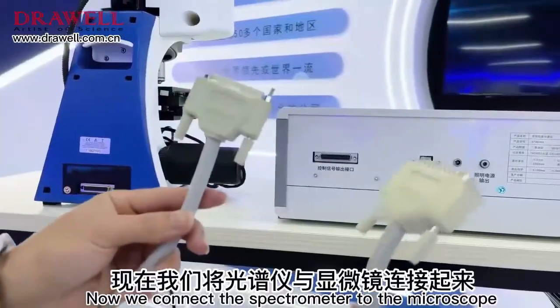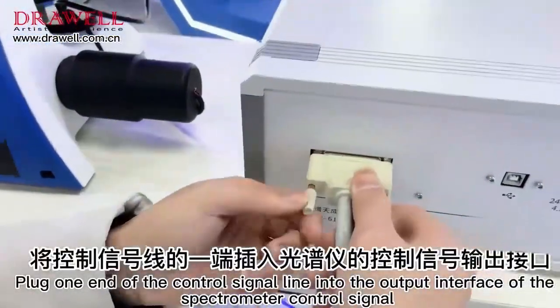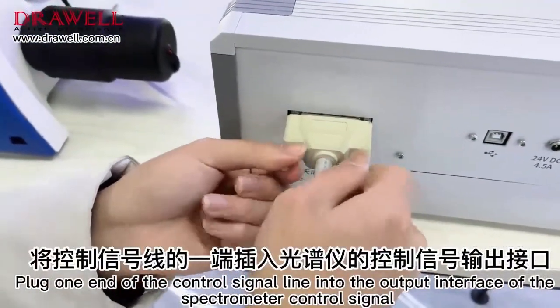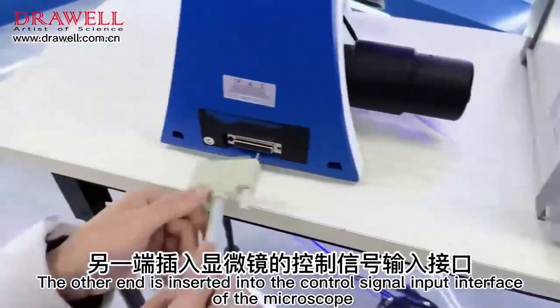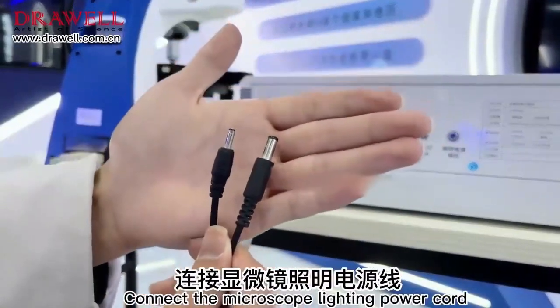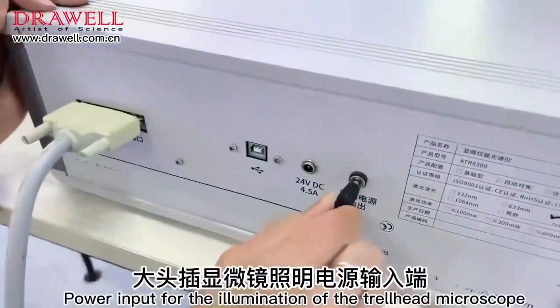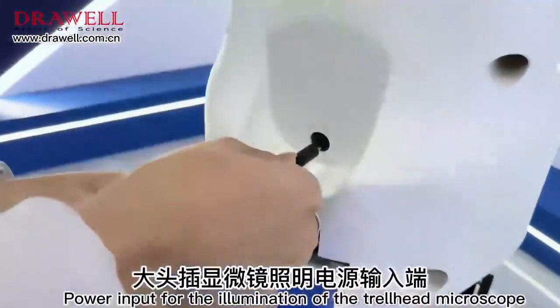Now we connect the spectrometer to the microscope. Plug one end of the control signal line into the output interface of the spectrometer control signal. The other end is inserted into the control signal input interface of the microscope. Connect the microscope lighting power cord. Small head insert spectrometer lighting power output. Big head insert power input for the illumination of the microscope.